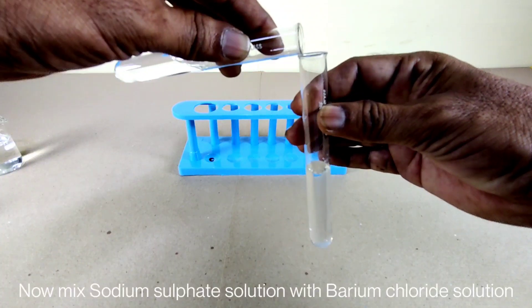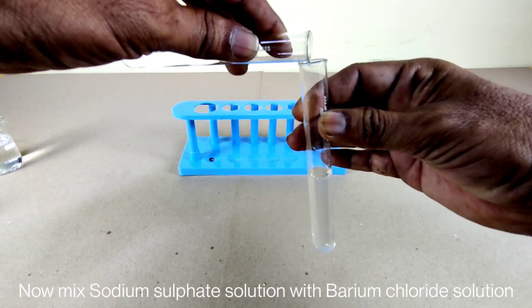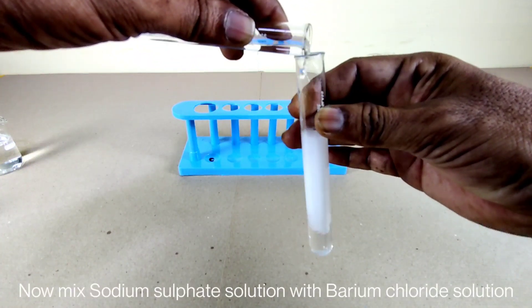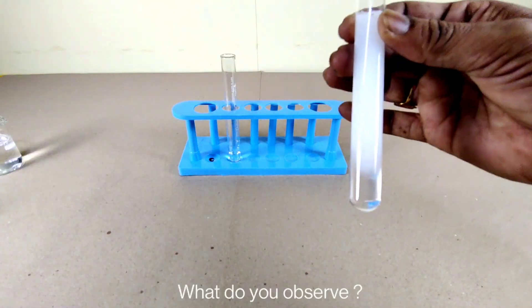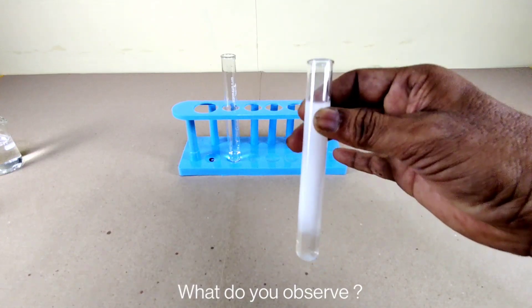Now mix the sodium sulfate solution with the barium chloride solution. What do you observe?